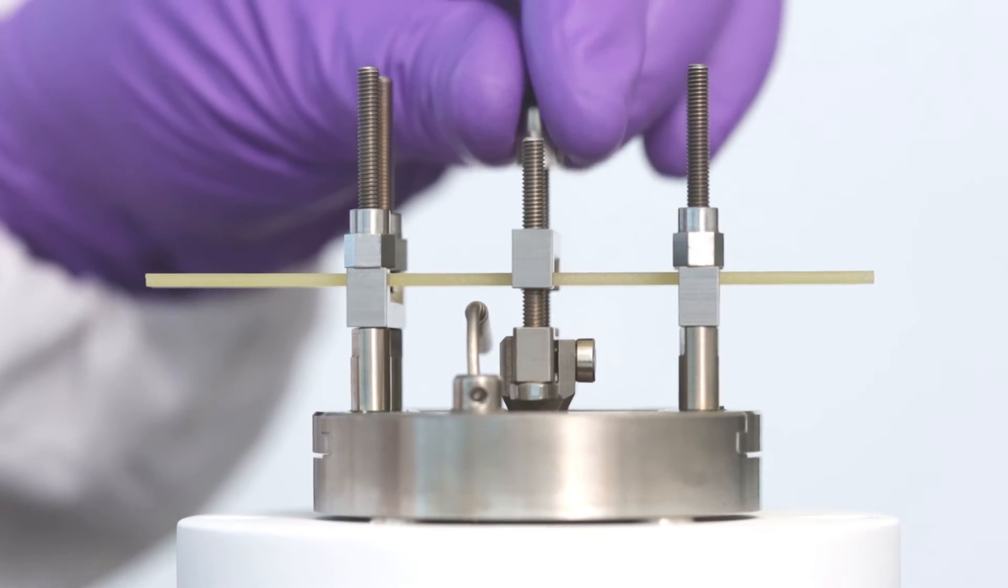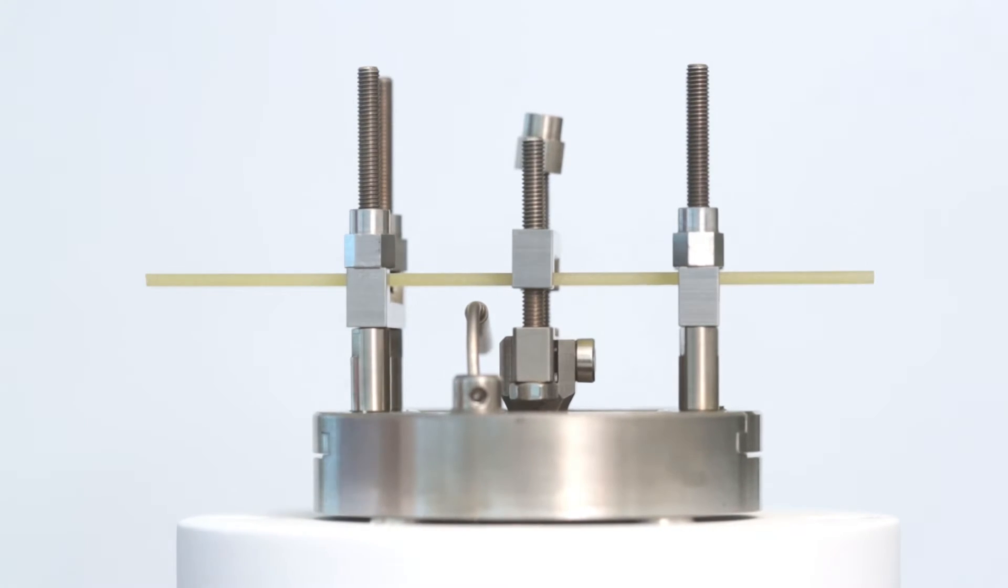Then, gently screw the two extended nuts onto the middle clamp bar without tightening them.